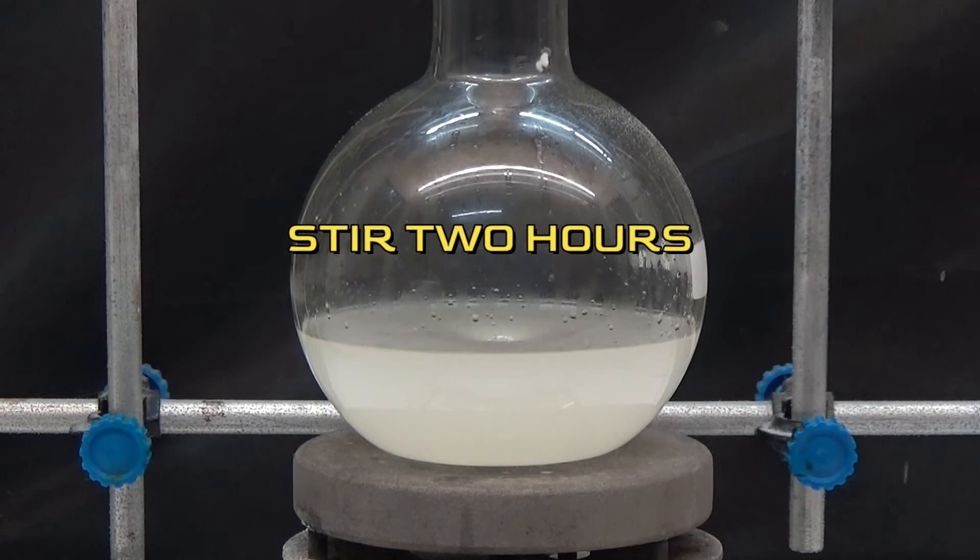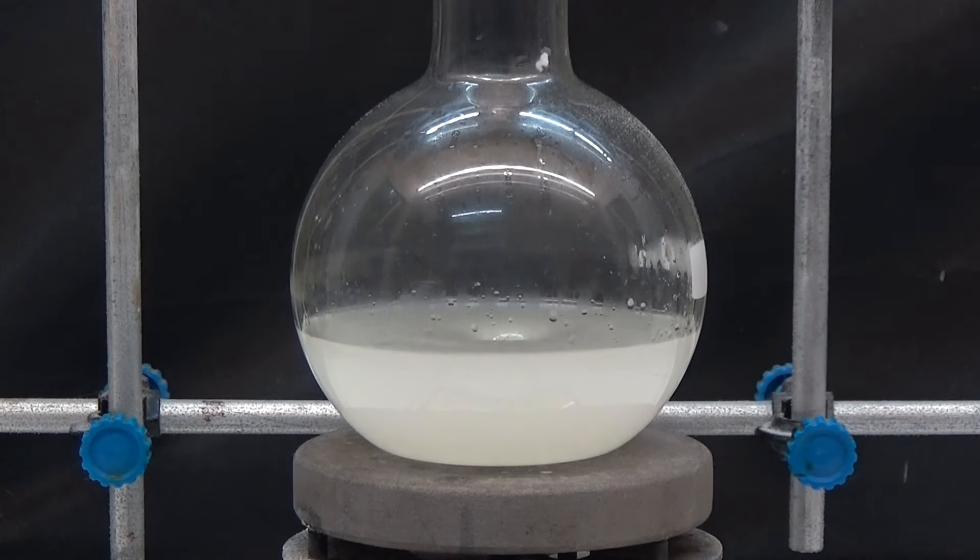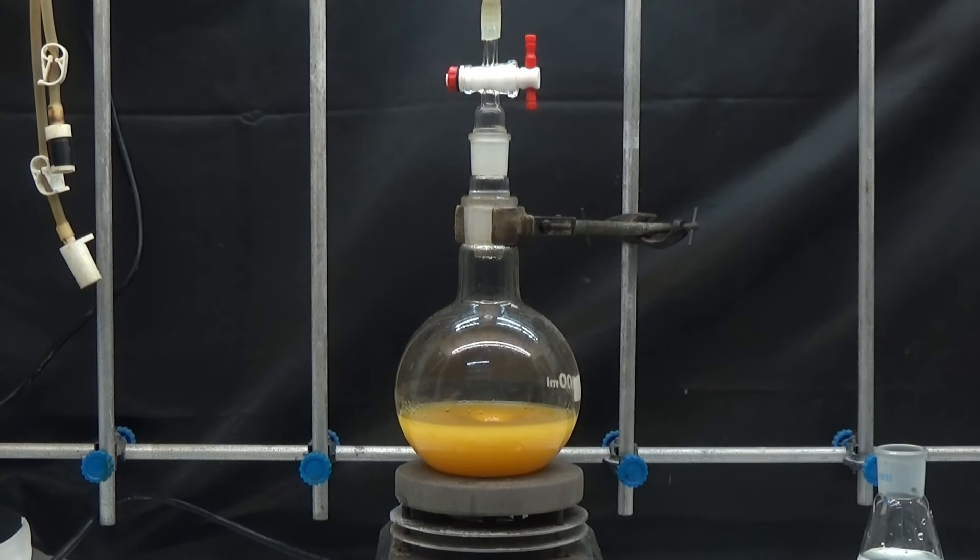We leave it to stir for 2 hours. During this time, it is observed that the reaction changes to a yellow-orange color.